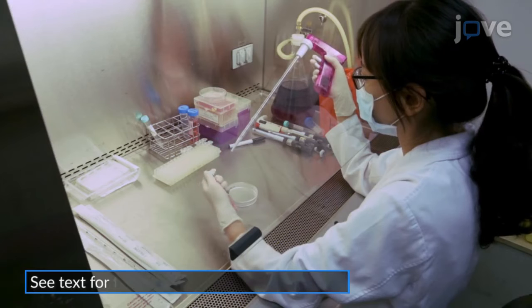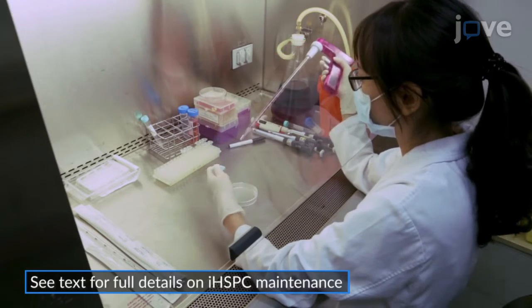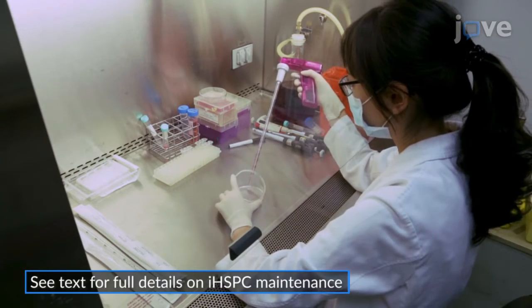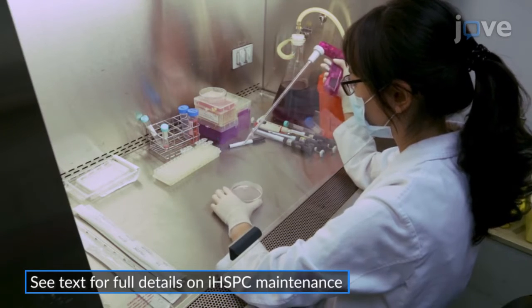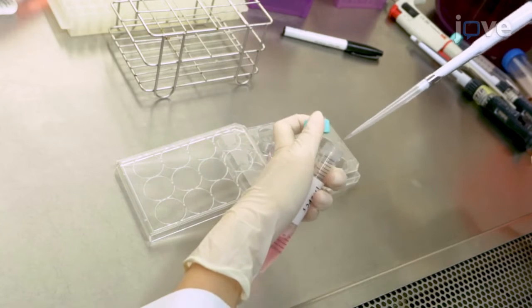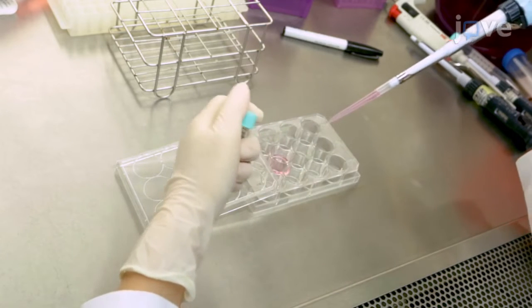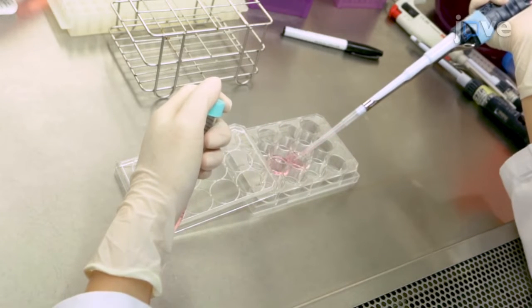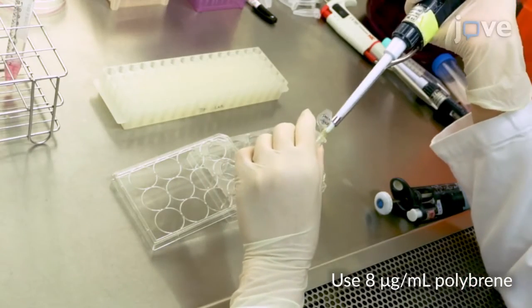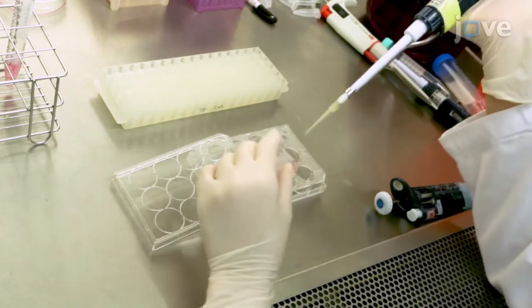To begin, maintain the immortalized hematopoietic stem and progenitor cells, or IHSPCs, in complete RPMI 1640 medium, supplemented with 100 nanograms per milliliter of the FLT3 ligand and 1 micromolar beta-estradiol. For lentiviral transduction, plate the IHSPCs in 12-well plates at a density of 1 × 10^5 cells per well and 1 milliliter of complete medium containing the FLT3 ligand, beta-estradiol, and polybrene. Then, add the lentivirus carrying the short hairpin RNA in each well at a multiplicity of infection of 100.